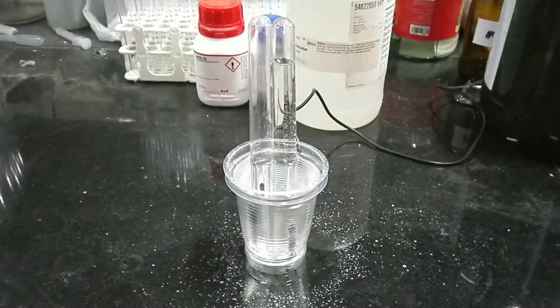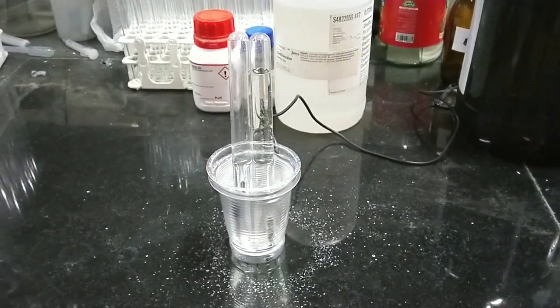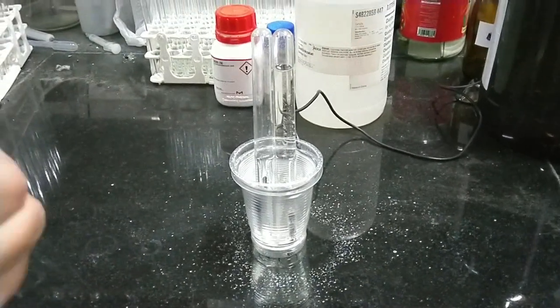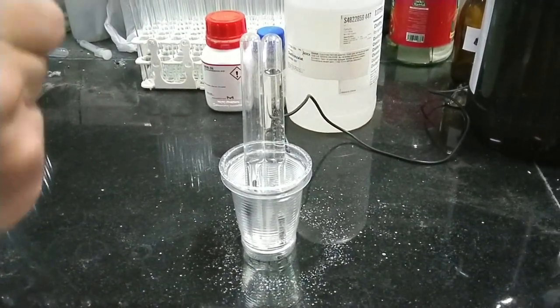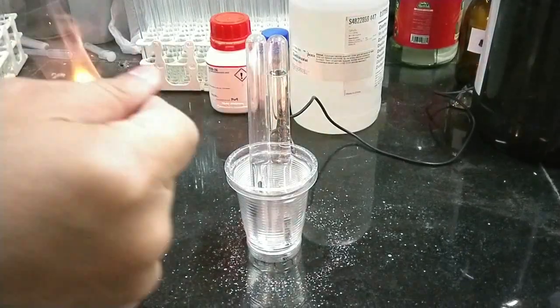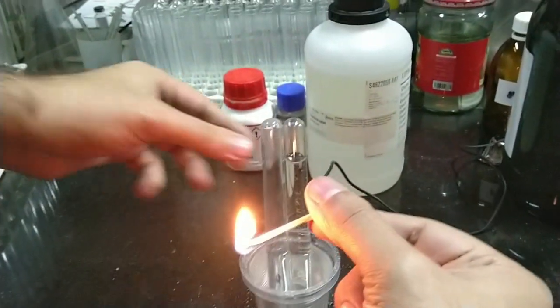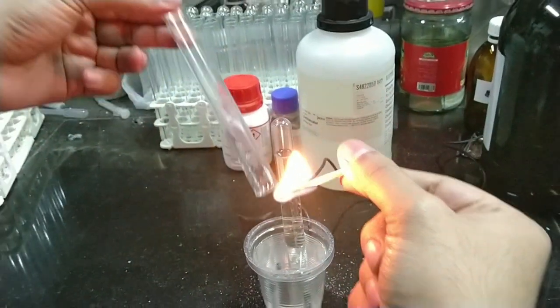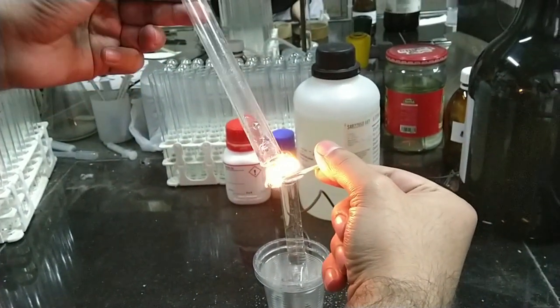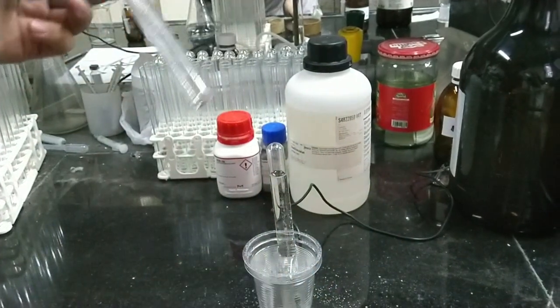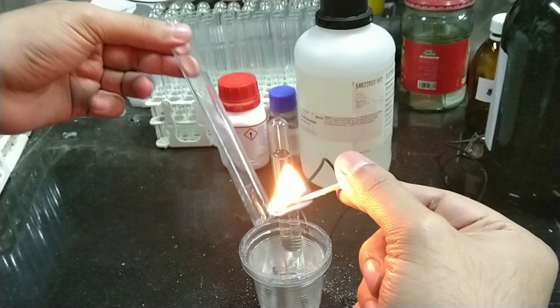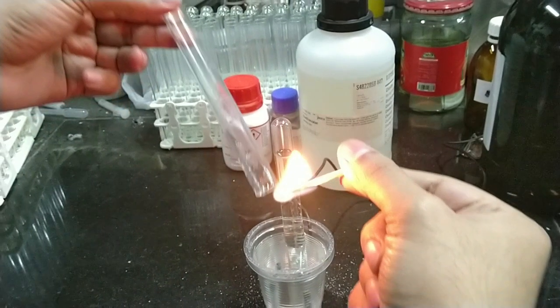Now it's time to test the hydrogen gas blast. Here I have a flame and this is my hydrogen gas. As you see it blasted. You can see a slow motion view of the hydrogen blast.